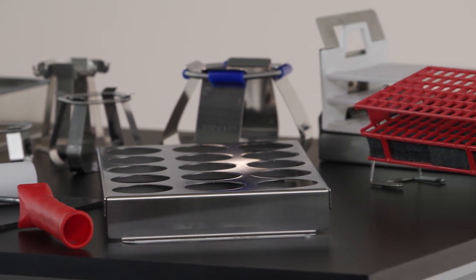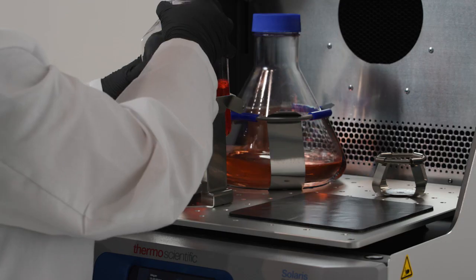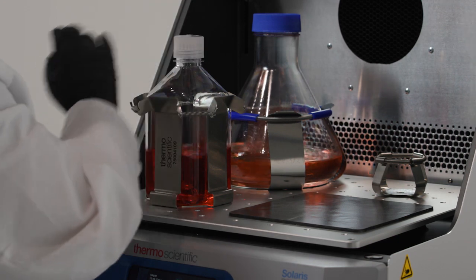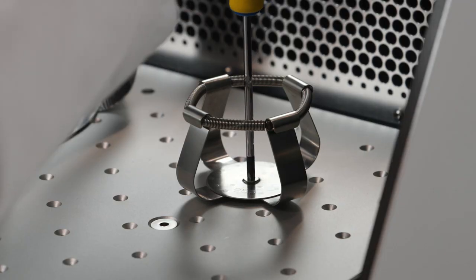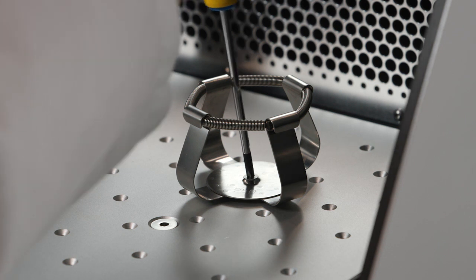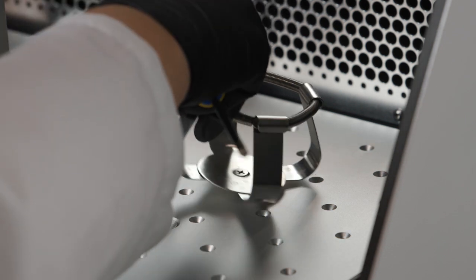Our portfolio of vessel clamps is always expanding, so reach out to our customer service or sales team if you are looking for a specific item. Replacement screws are available too, and their catalog numbers can be found in our brochure and on our website.